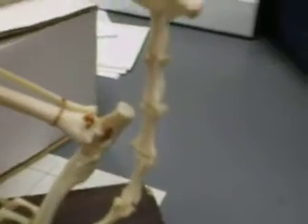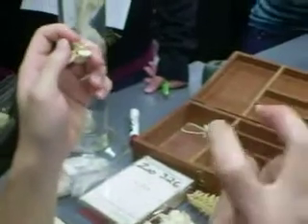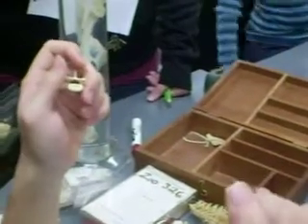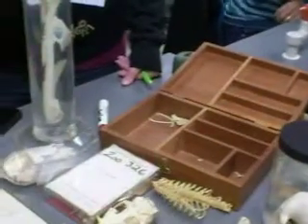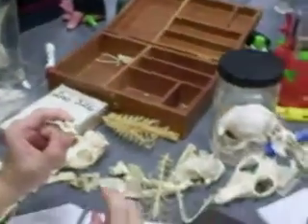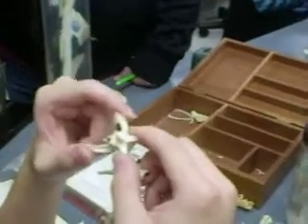So the important thing about these vertebrae is you need to distinguish the zygapophysis. There are two types of zygapophysis: anterior zygapophysis and posterior zygapophysis, also known respectively as the pre-zygapophysis and the post-zygapophysis. To distinguish between those two, the first thing you need to do is orient where your vertebra is. So, you know very well that this point's anterior, right?